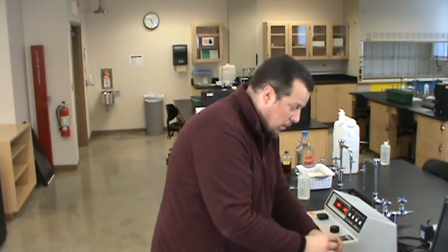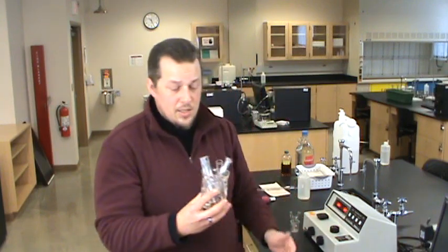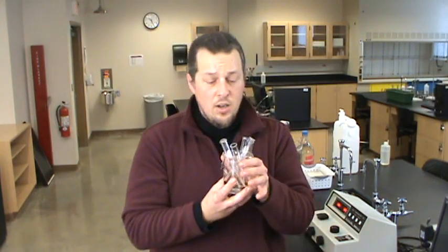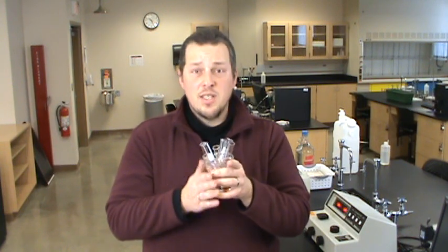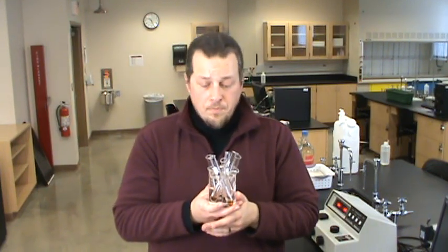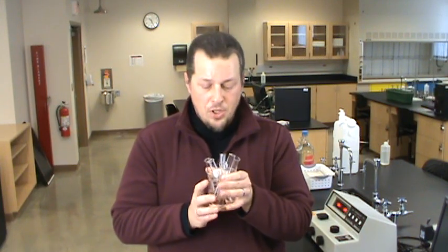The other thing that we're going to do is keep these tubes in a room temperature water bath, because temperature is extremely important when we're looking at rates and when we're looking at activation energies. So we need to know the temperature of all of the samples we measure. By using a water bath like this that's at room temperature, we'll have a more consistent temperature to record for room temperature on any given day. Make up your samples, keep them in the bath until you're ready to use them.